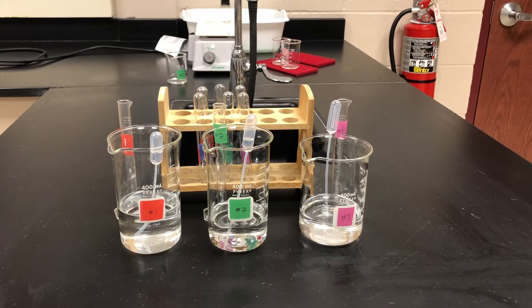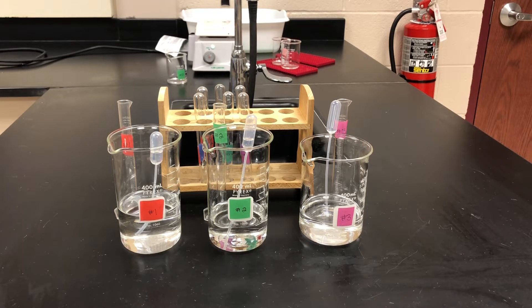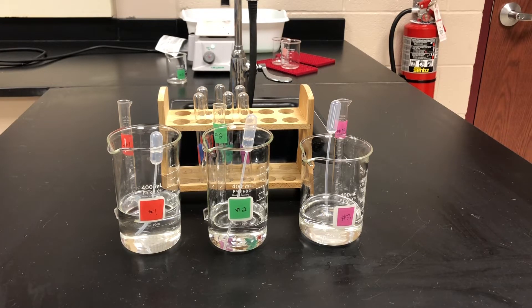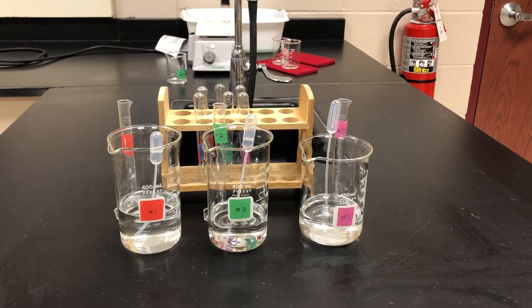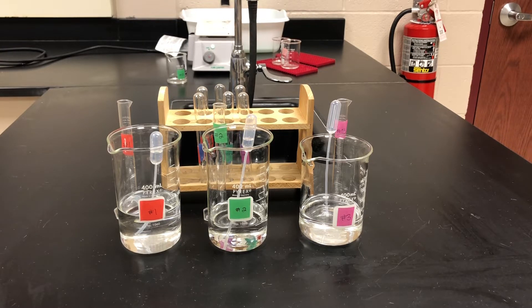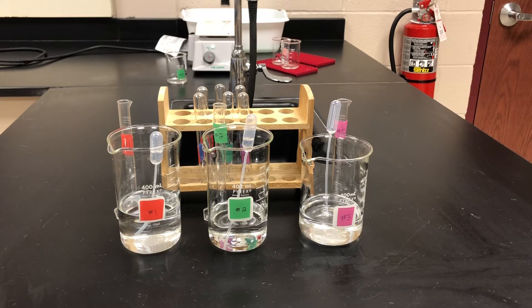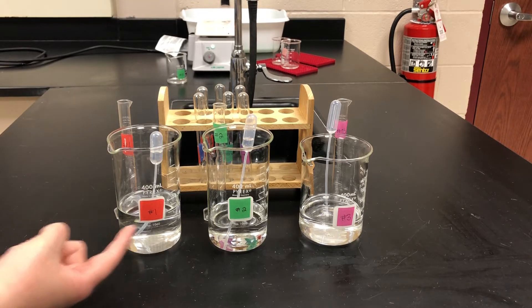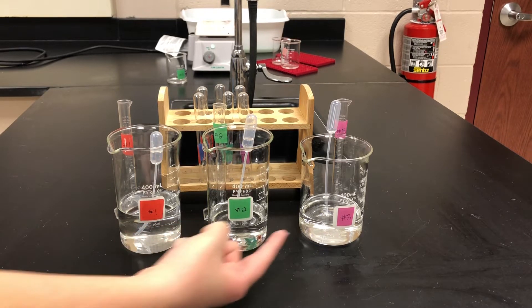In today's lab experiment we are going to use various physical and chemical properties of these unknown liquids in order to identify them. We have liquid number one, liquid number two, and liquid number three.